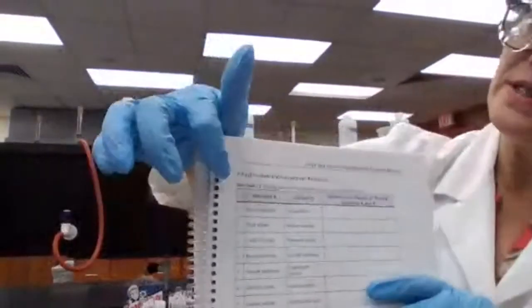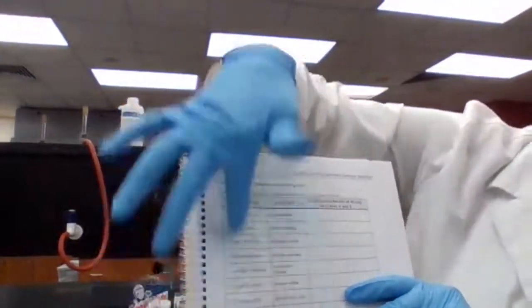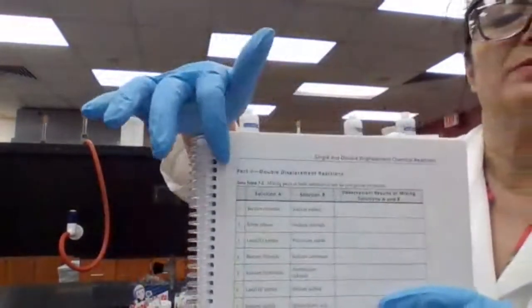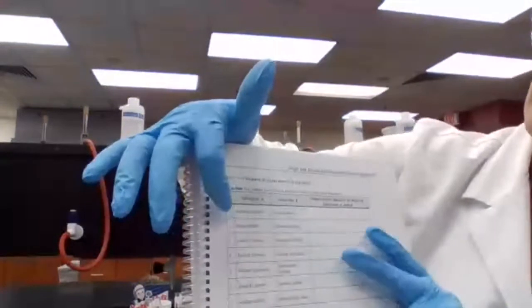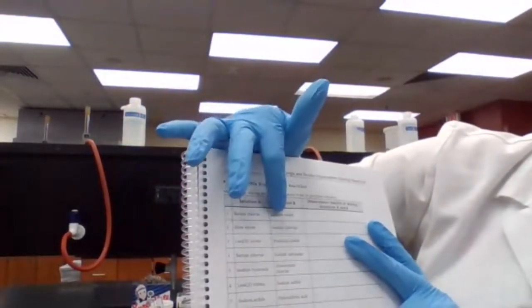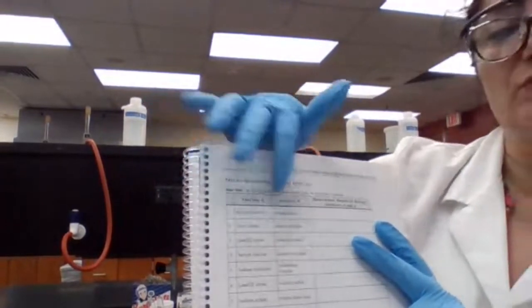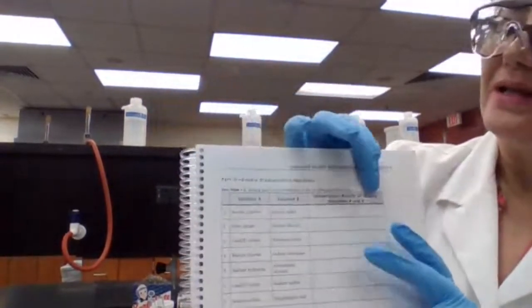So basically, for this experiment, we are going to take our test tube A or test tube 1. These are 1 to 12, okay? We have 12 test tubes. In test tube 1, we are going to add a solution of barium chloride and a solution of sodium sulfate. These two are in solution form because both of them are soluble.